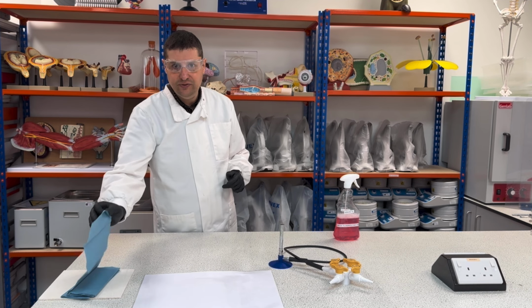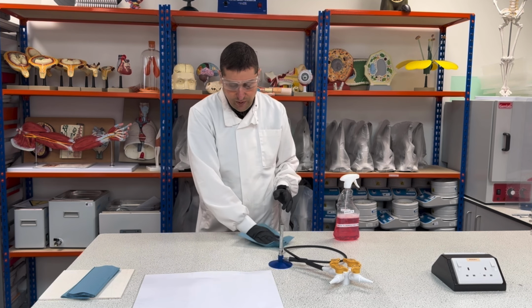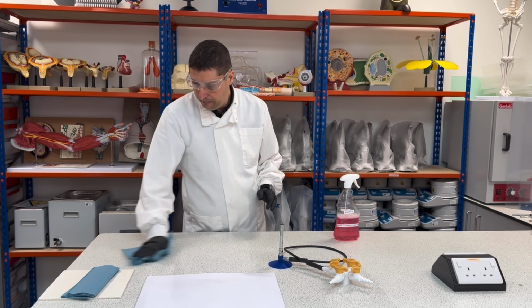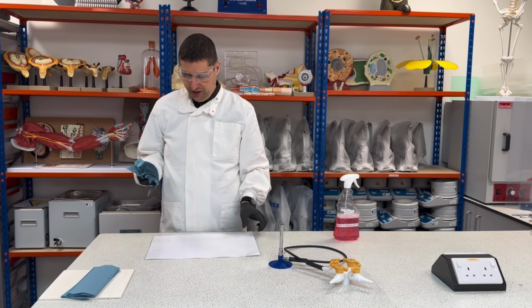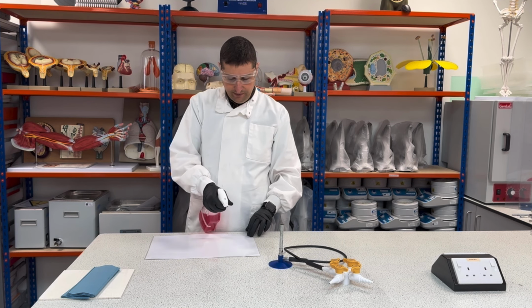So for this video, I will just wipe it off now, but remember, you need to wait at least 1 minute to wipe this off. So now I can take my workstation here, and I will spray it as well.